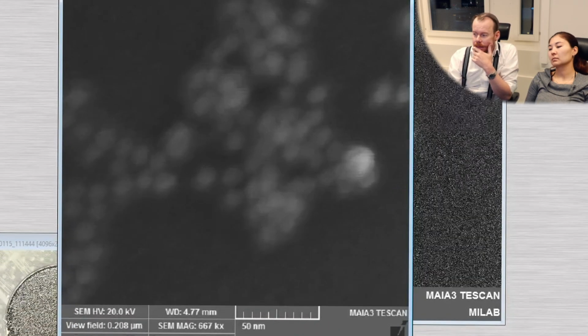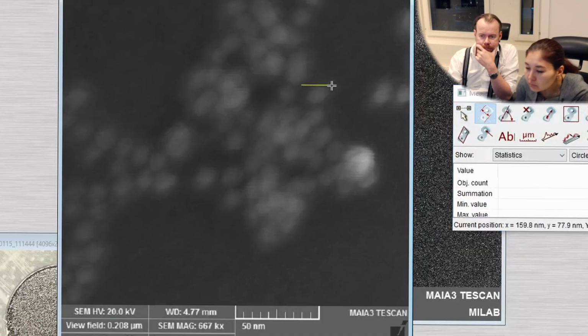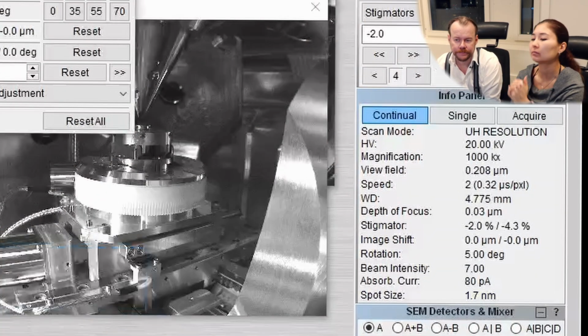So let's look on this. What is the size of it? Take the measurement panel. So the particle is 10 nanometer. It's a pretty damn small particle. And the spot size we're using now is 1.7. And this machine has a line resolution of 1 nanometer. And that is if we're using 1 kV. Now we're at 20 kV. So the higher the voltage, the easier it is also to maintain a high resolution. But the thing with the high voltage is that we also shoot straight through everything.